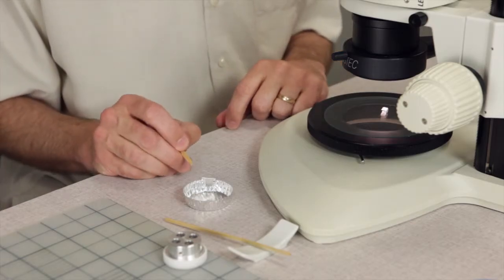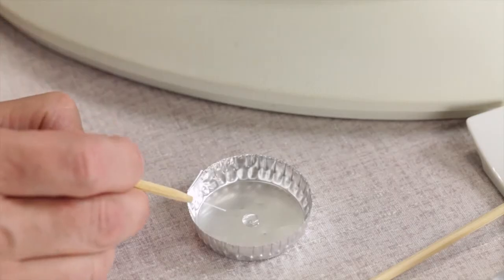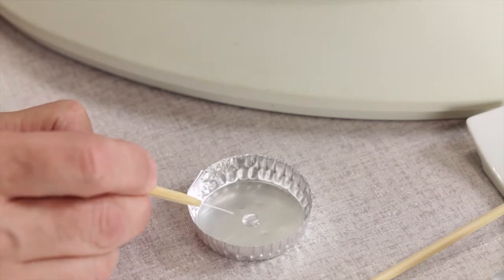I've added a droplet of cyanoacrylate and I can transfer it with this home-built needle tool that's made out of fishing line.